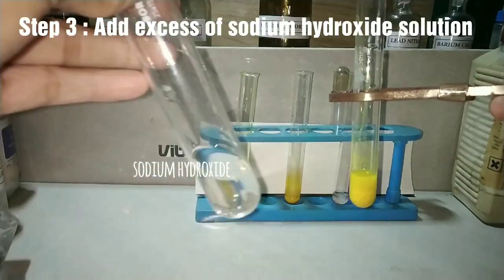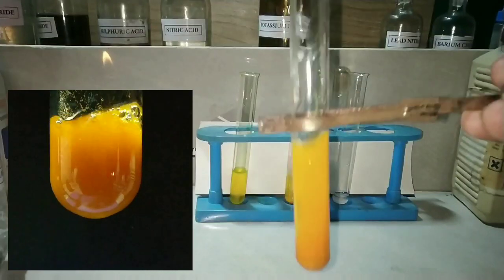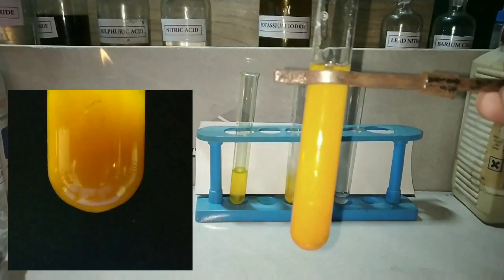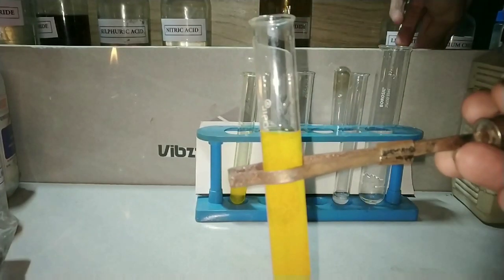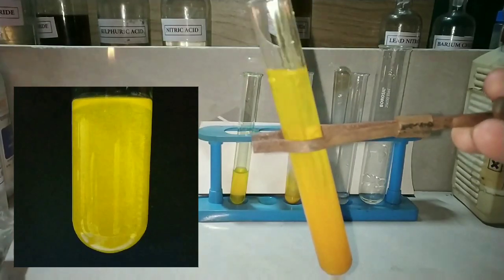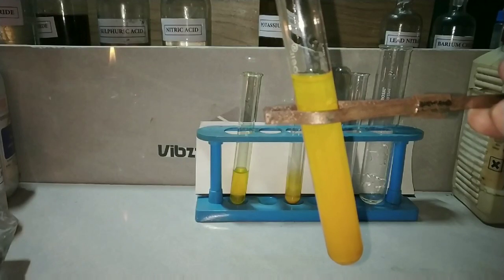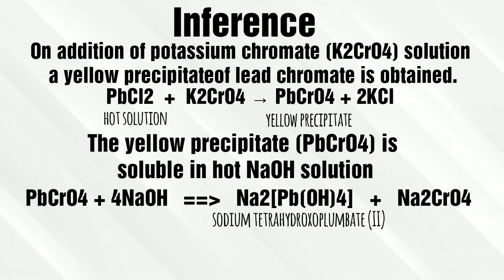Now we add excess of sodium hydroxide into this precipitate. The sodium hydroxide is already heated to boiling. On adding the hot sodium hydroxide solution, you can see that the precipitate is slowly dissolving and the solution is acquiring a yellow color. After mixing with a glass rod, the precipitate has dissolved and the solution has turned into a bright yellow color. The yellow precipitate formed was lead chromate, which dissolved in hot concentrated sodium hydroxide to form a complex called sodium tetrahydroxoplumbate(II).